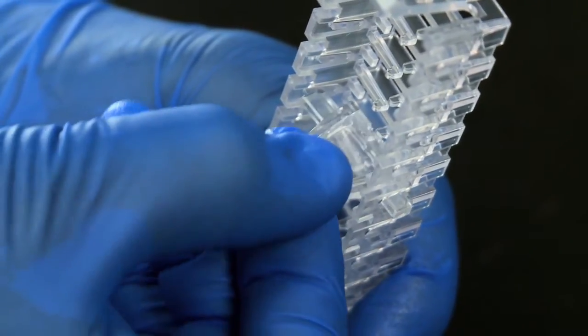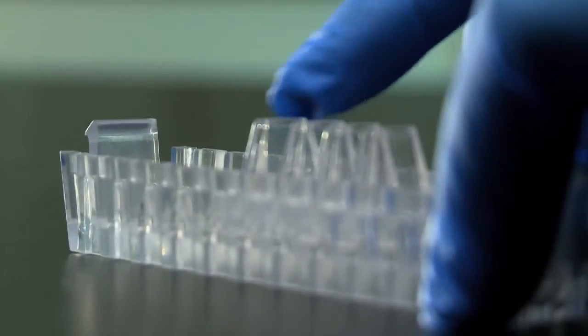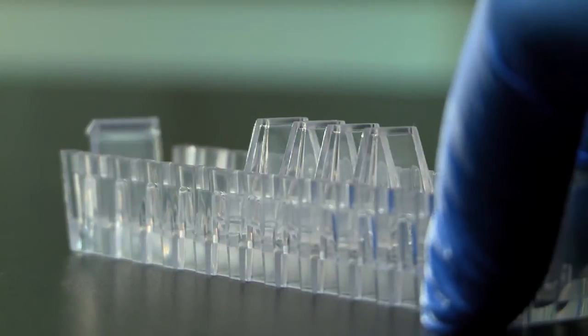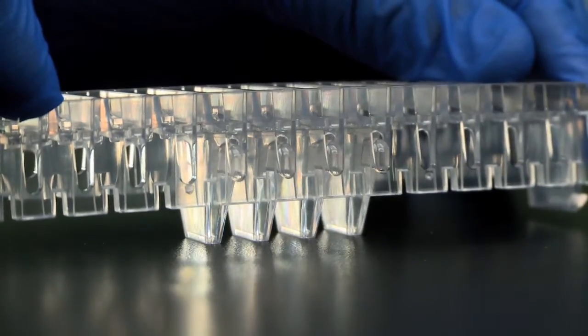The holder is designed to hold the cups with a certain amount of give to allow a tight seal with the gel so that the sample doesn't leak and to ensure that the connection is not so tight as to damage the strip.